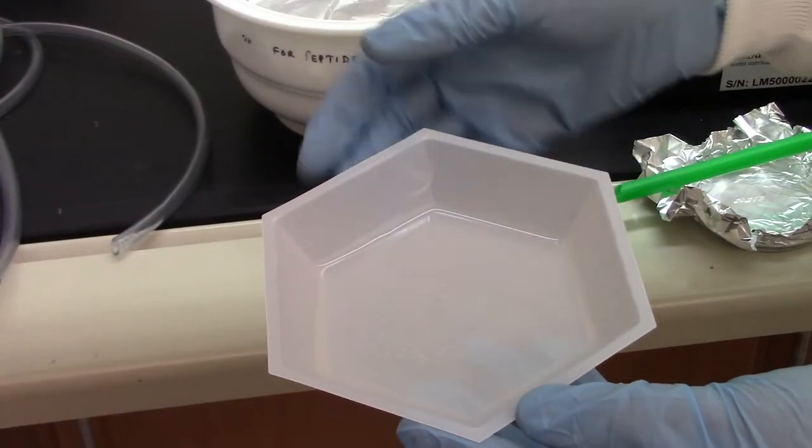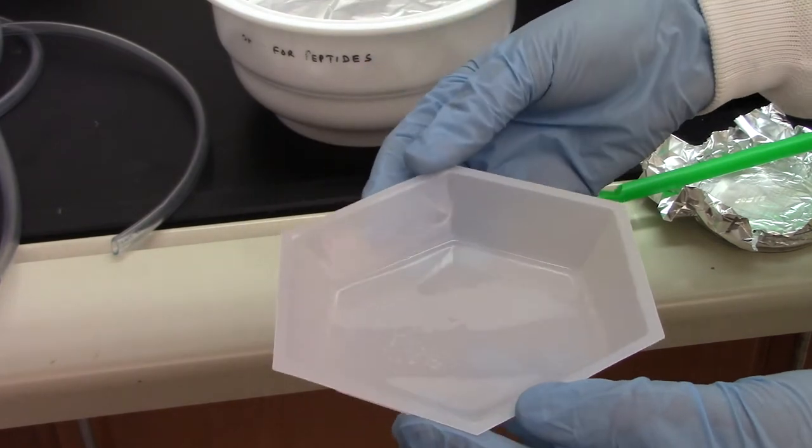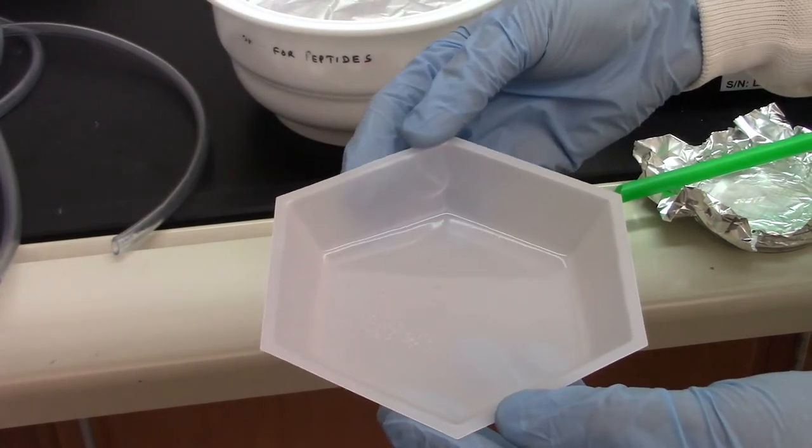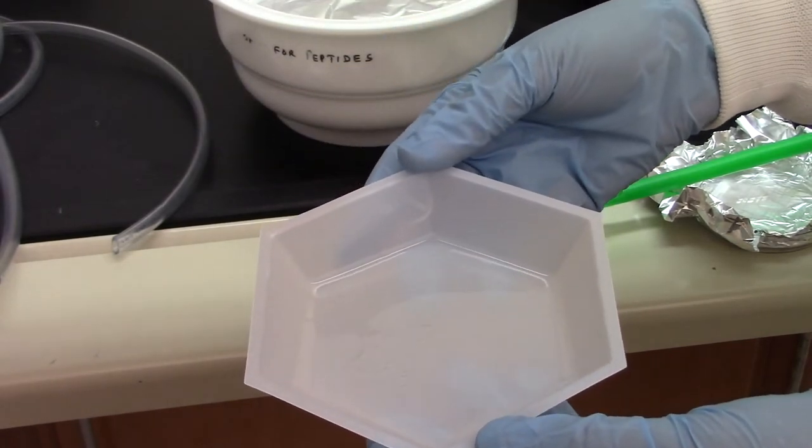So now you can see there's still a few air bubbles within the mixture, but this is an acceptable amount. Compared to before we put this in the vacuum chamber, there was a lot of air bubbles. So we successfully degassed our PDMS.